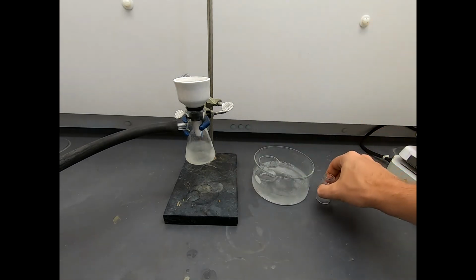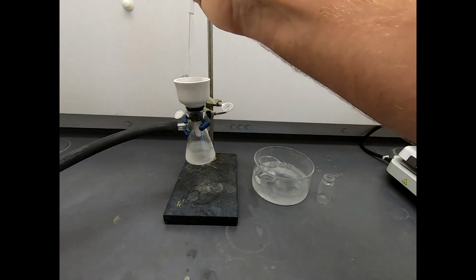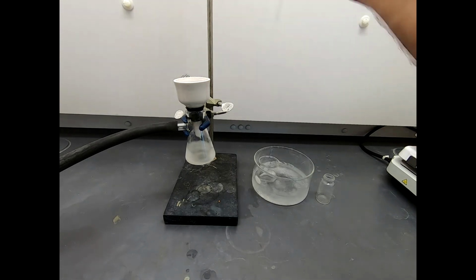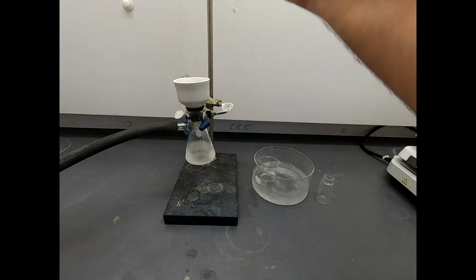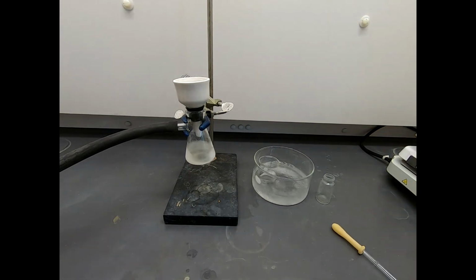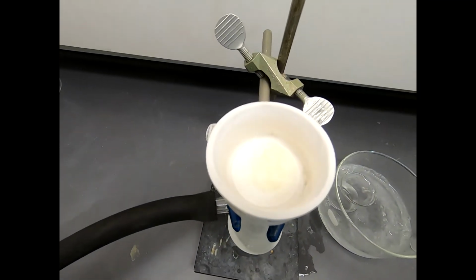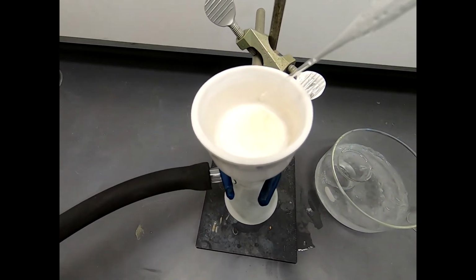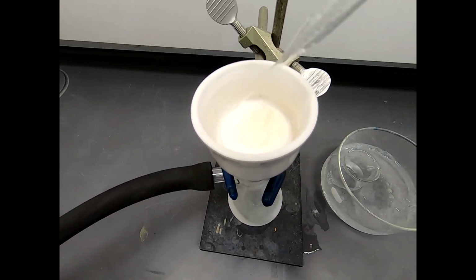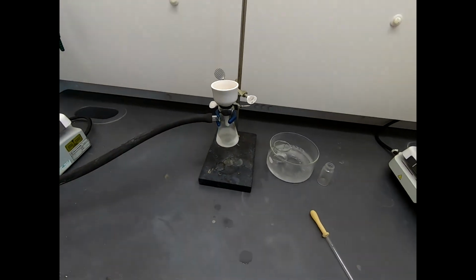That's good enough. Now let's take what solvent we have left in this chilled solvent, and I'm just going to squirt it around the filter paper and rinse off any residue off our product. And I think that's plenty. Now let's take the camera and peek down in there. I don't know how that contrasts, but there's a decent amount of solid here towards the right, a little bit more bare paper on the left, but that's good. That's our solid. We've collected it.